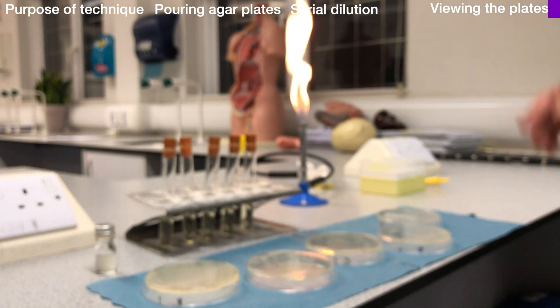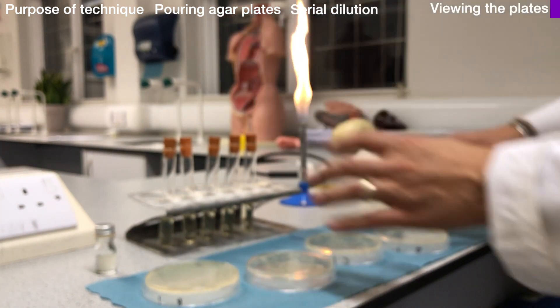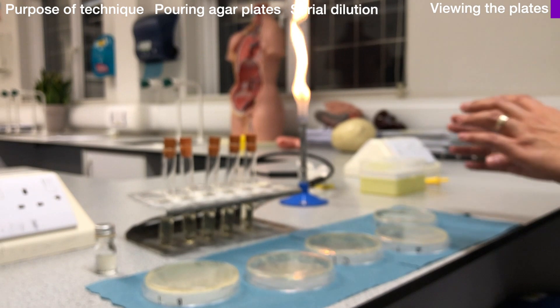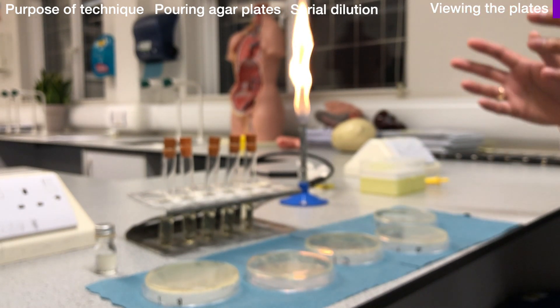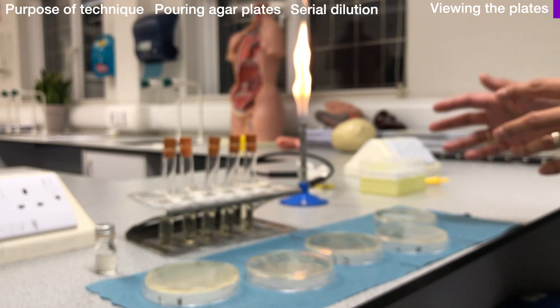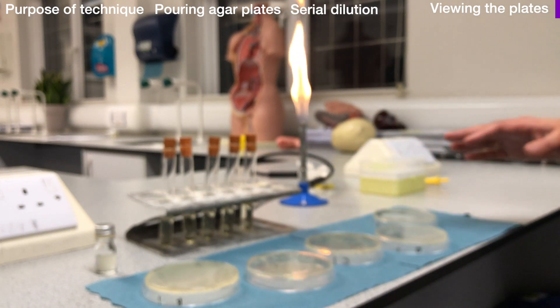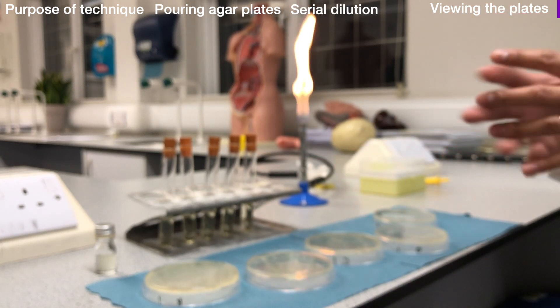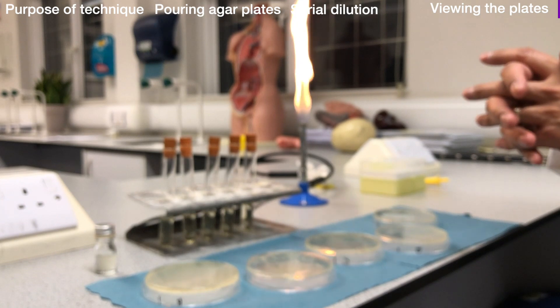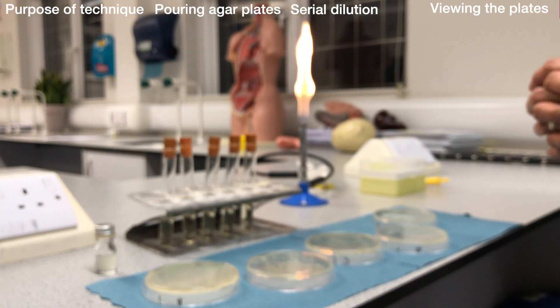At this point, all the glassware would go to be autoclaved and sterilized. We will disinfect this area, then wash our hands with antibacterial soap.